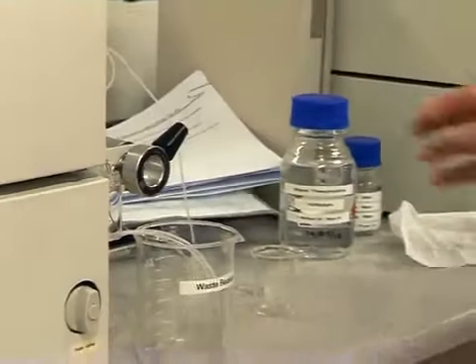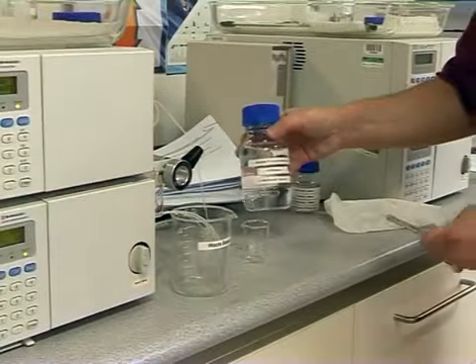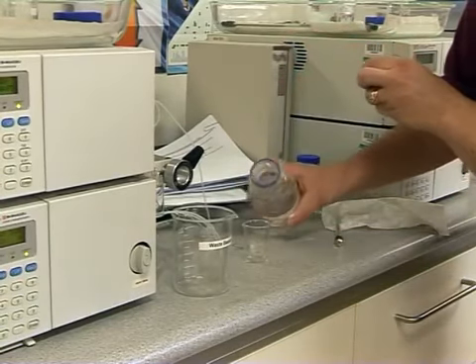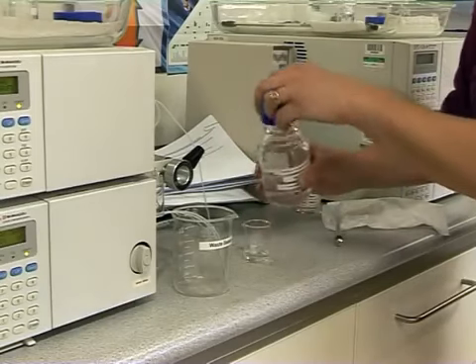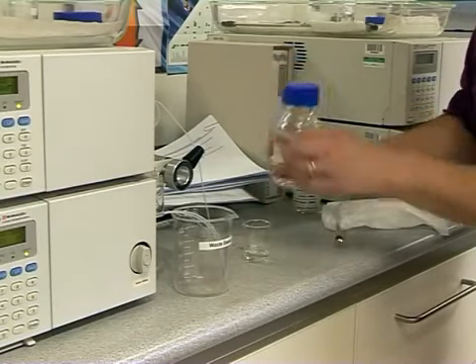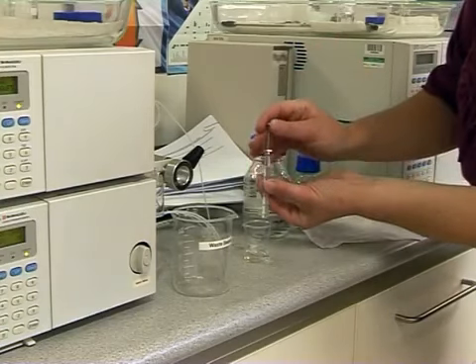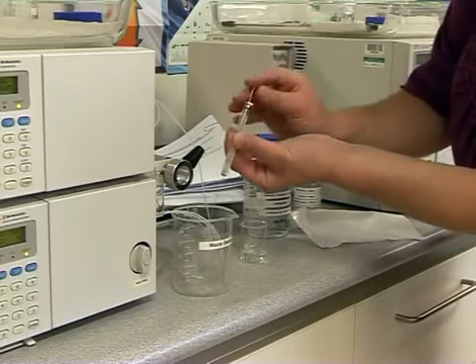Rinse and prepare your sample for the next sample run as previously demonstrated. When changing to a different sample analysis, remember to change the information in the Sample ID box. This is the only information that needs to be changed for any subsequent samples.